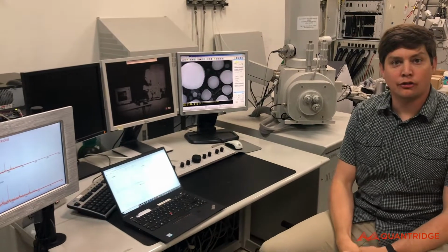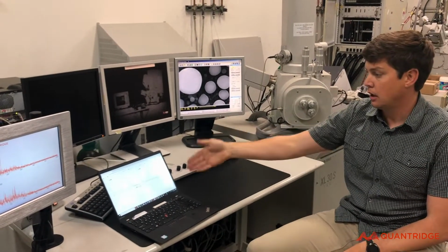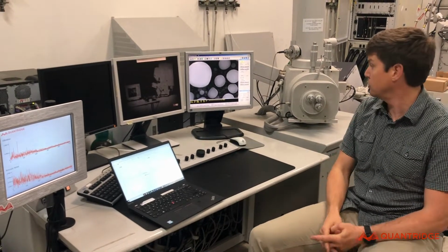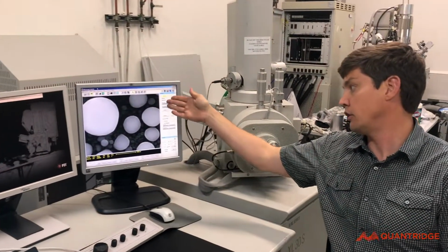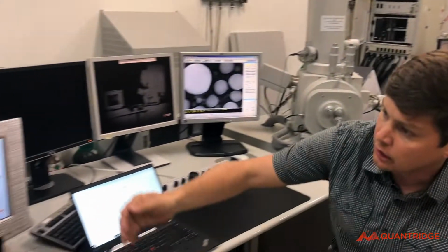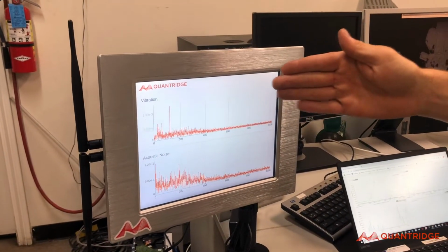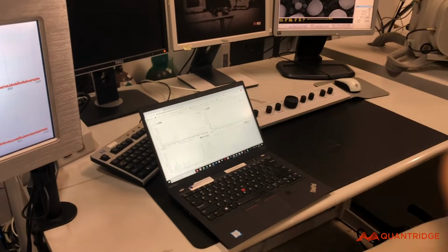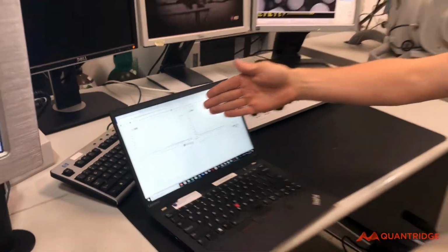Okay, so what you guys saw there was obviously the vibration jump on the real-time display. You saw it jump with a 10-second delay on the cloud-based solution. And you saw a disturbance in the image. And now you can see that we return to normal. We have a clean scan. The vibration source that we were seeing on the real-time display is gone. And now we are well within specification for this tool, as you can see on the IoT cloud-based version here.